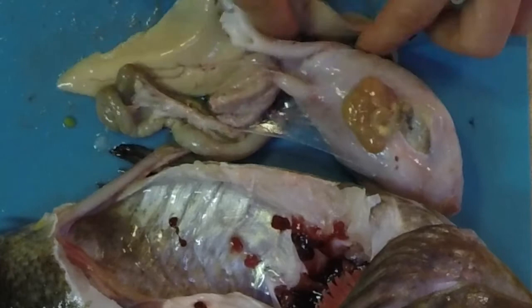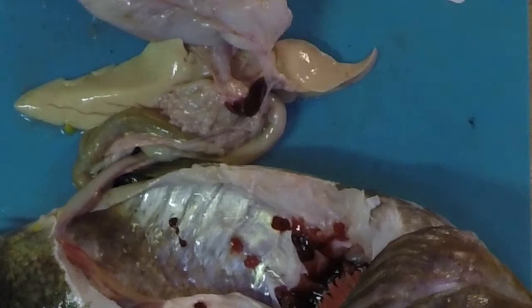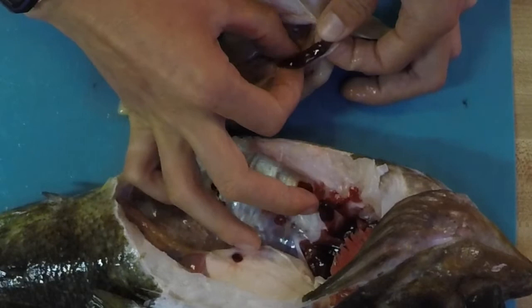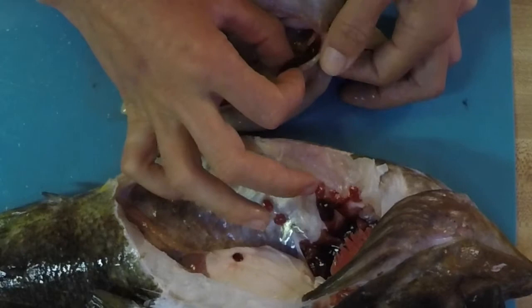And there's this little red organ right in there — this little red organ is actually the spleen. The spleen is a really interesting organ — it's actually a non-vital organ, but it does help with blood purification, especially in regards to the immune system. So it kind of works as a glorified lymphatic system, focusing mainly on our red blood cells. This is the spleen tucked away within those intestines.